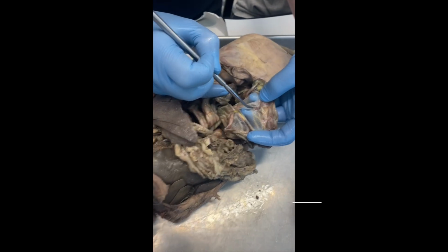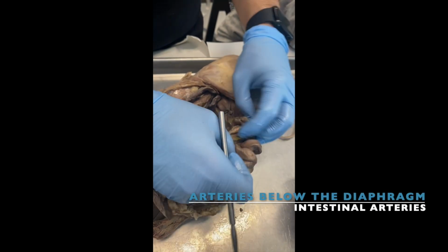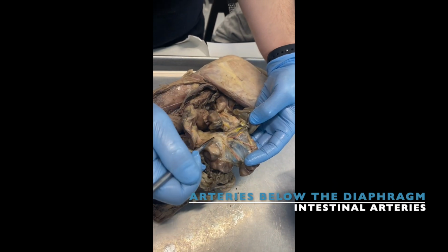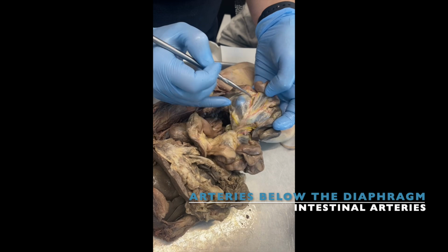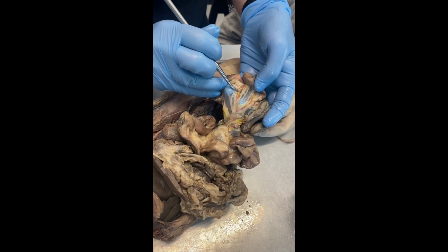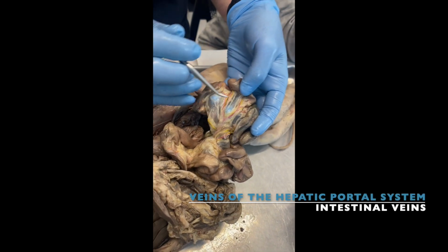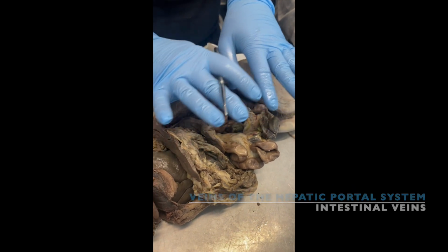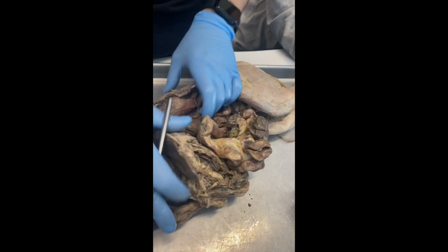See these arteries in pink, reddish? Those are the, guess what's the name? If those are in your intestines. Yep, intestinal arteries. Very good. If those are intestinal arteries, what about these ones in yellow? Intestinal veins. Veins, okay? And now we will explain why that is yellow, not blue. But let's keep going.